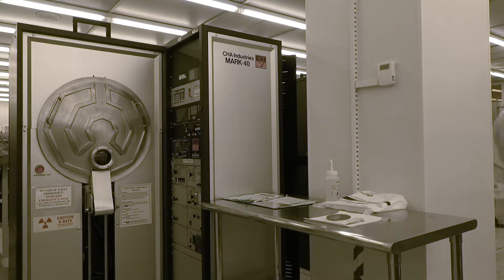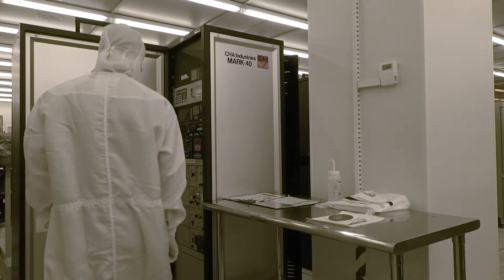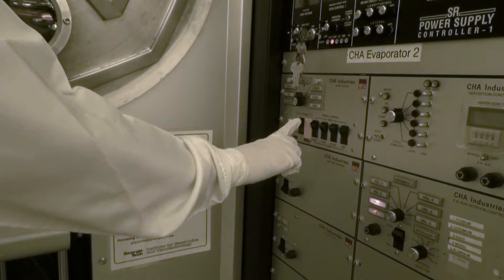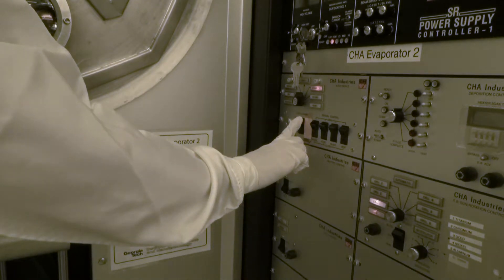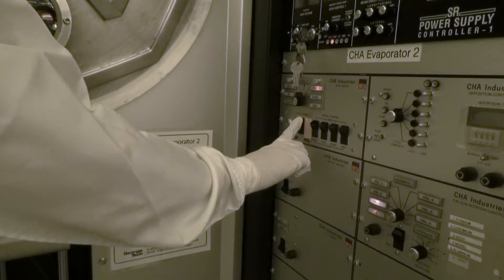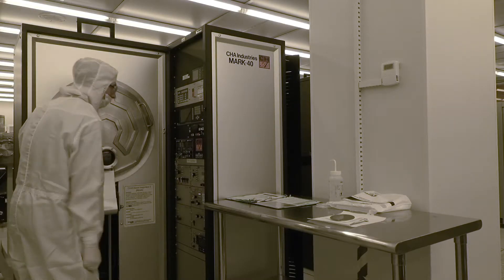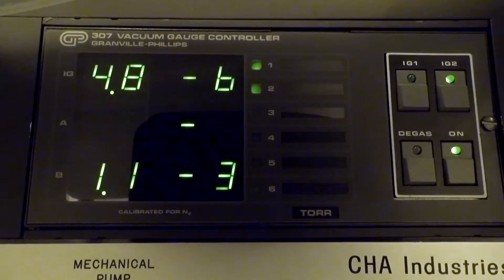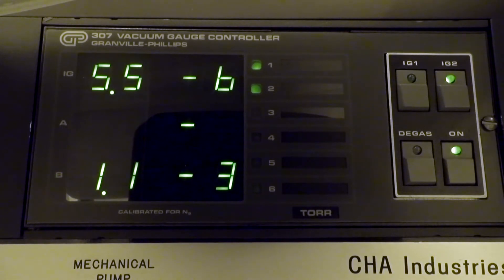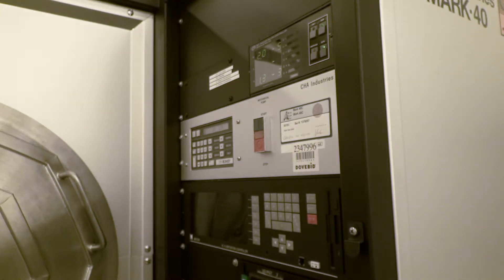To begin loading your samples, you must first vent the chamber. On the Autotech 2 controller, move the rocker switch to the standby position under Autocontrol. Wait approximately 5 seconds or until you hear a small popping sound — this means the cryopump valve has closed. Then move the rocker switch to vent. It will take a few minutes for the chamber to fully vent. Wait for the bottom gauge B on the vacuum gauge controller to read approximately 7.6×10² Torr.